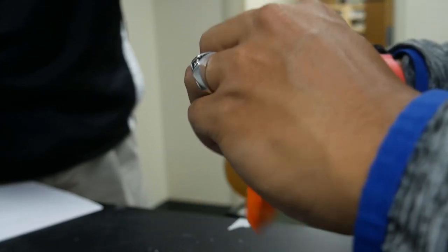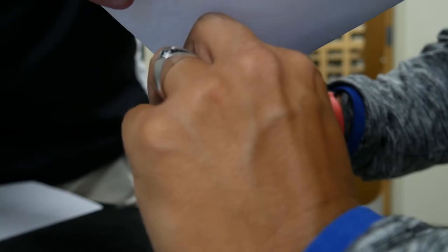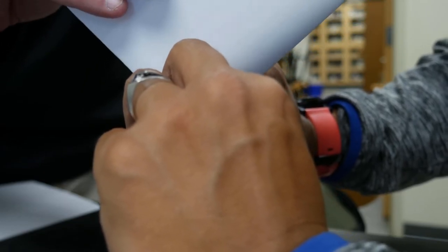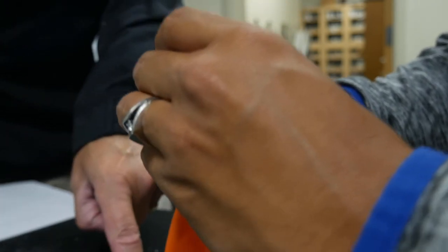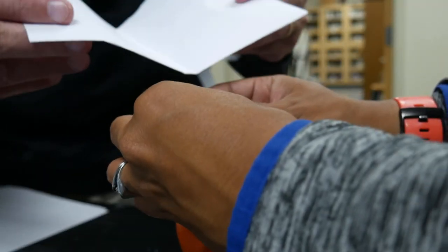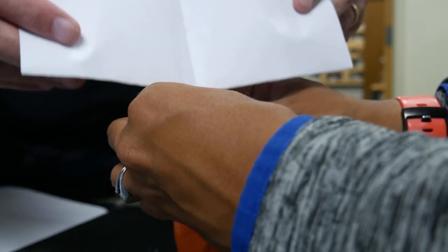We're going to pour our baking soda into our balloon as best we can. Very carefully, we'll pour it in there. We spilled some — we'll take note of that in our conclusion as human error. We're recovering the lost baking soda that landed on the table to keep our numbers as close as we can get them.